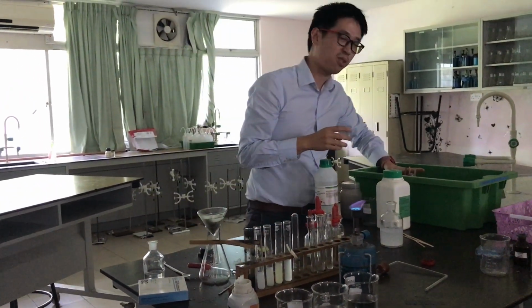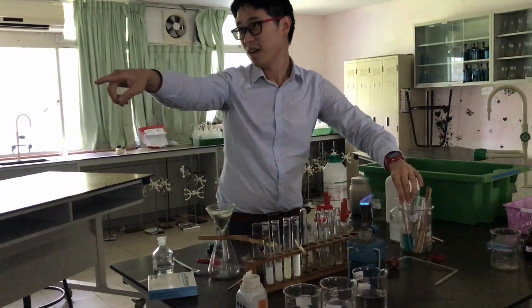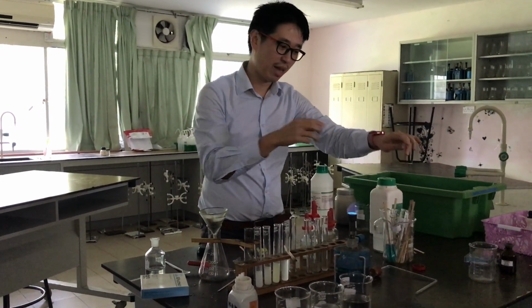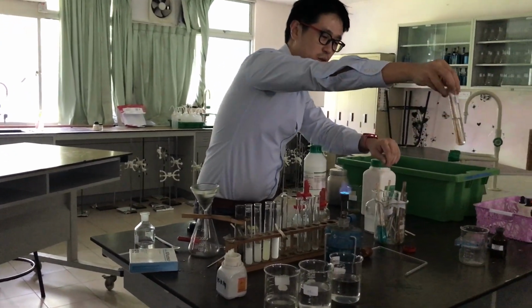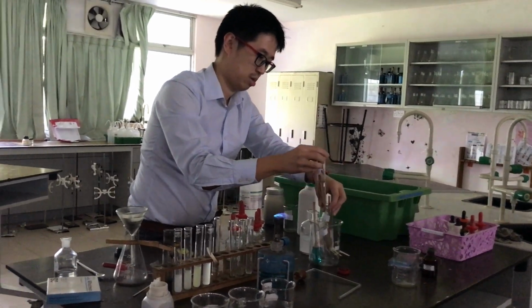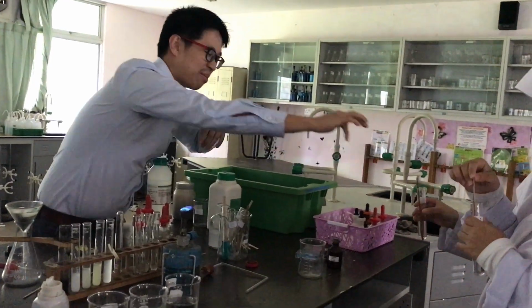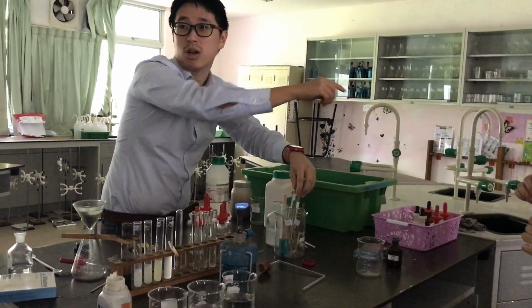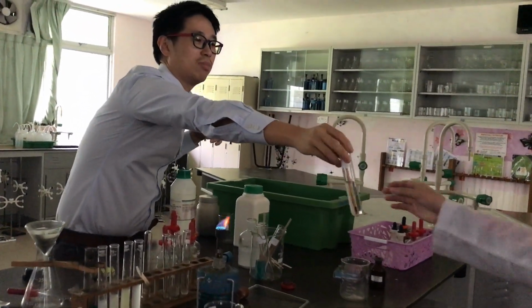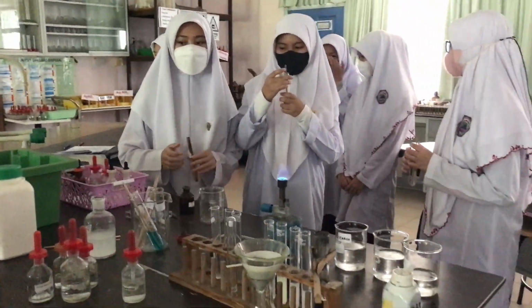So we're going to do the flame test first, yeah? Remember there are three ions that you need to test for right at the bottom. What are the three cations? Not the metal, but the cation, okay? Now Zakira, you hold sodium. Michelle, come. Yours is lithium, okay? Don't worry, the labels are lost, okay? Michelle is holding lithium, and someone is holding potassium. Which one should we do first? Lithium first. You hold lithium, yeah?